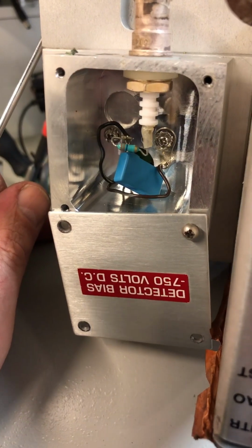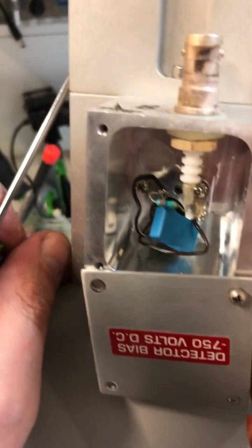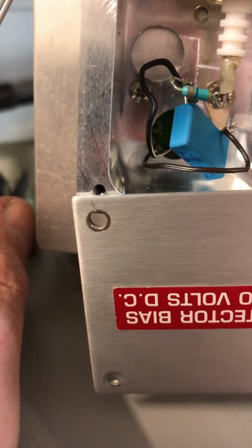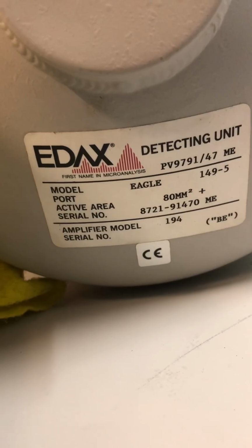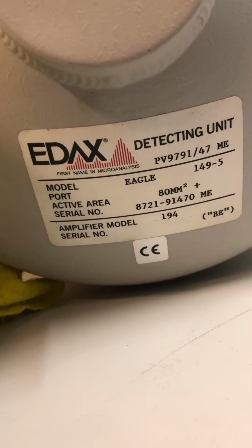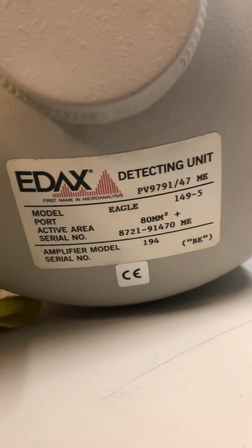Detector bias voltage box: there is a high resistance resistor, a capacitor, and then 2 wires go to the vacuum feedthrough. The detector is insulated with a plastic ring to prevent ground loops. Detector area is 80 square millimeters, it's about 9 millimeters in diameter.